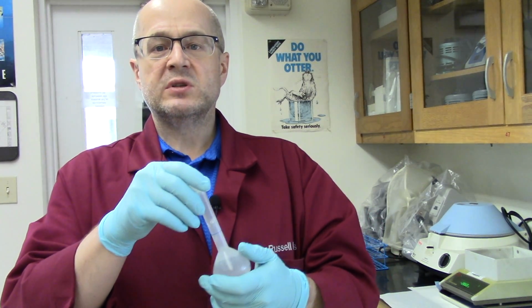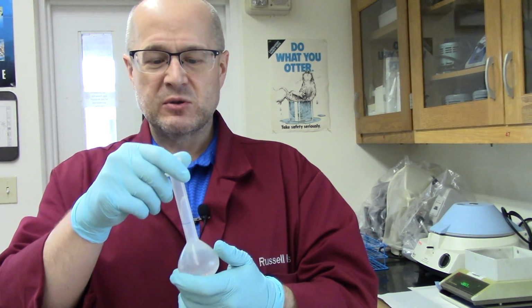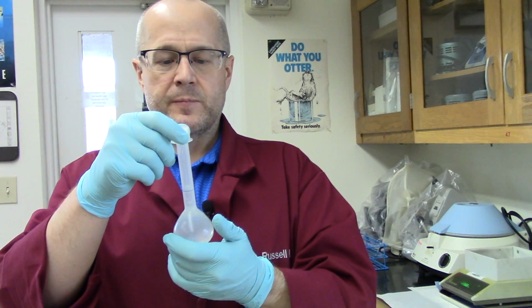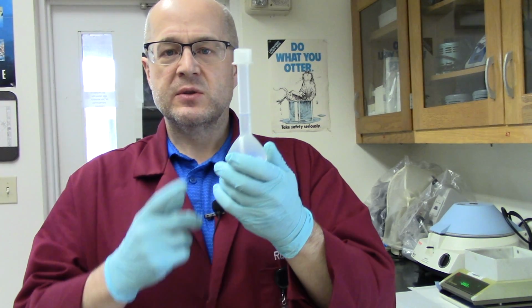If not, we'll just calculate a percent error and learn something about science, that it's not always easy to hit a target. But with practice and skill, we all get better at it. Okay, so this one is ready to measure.